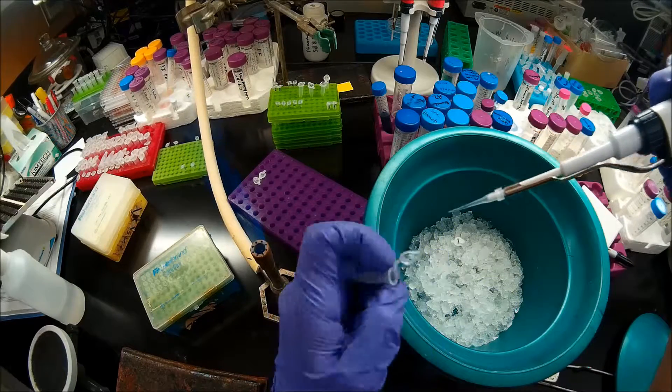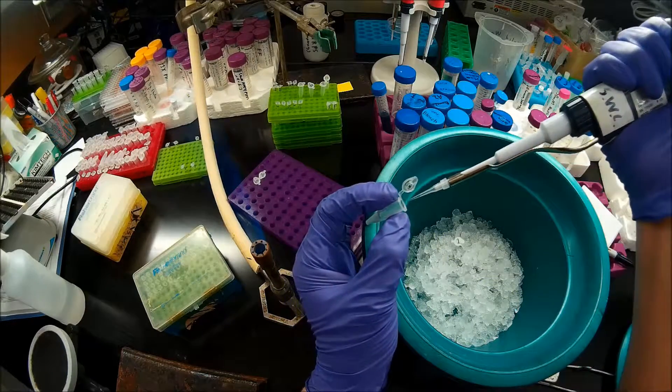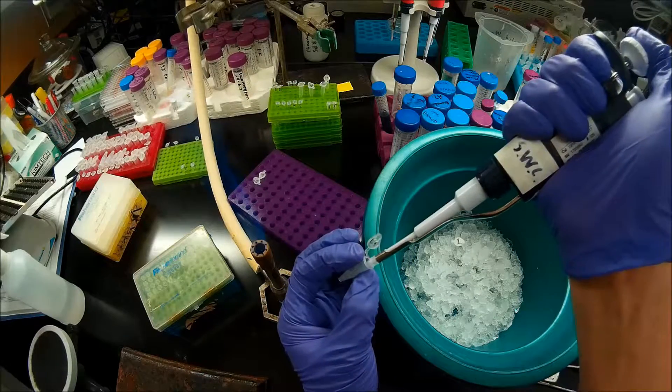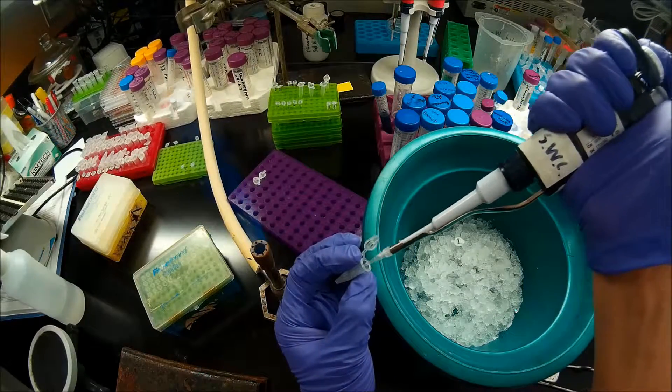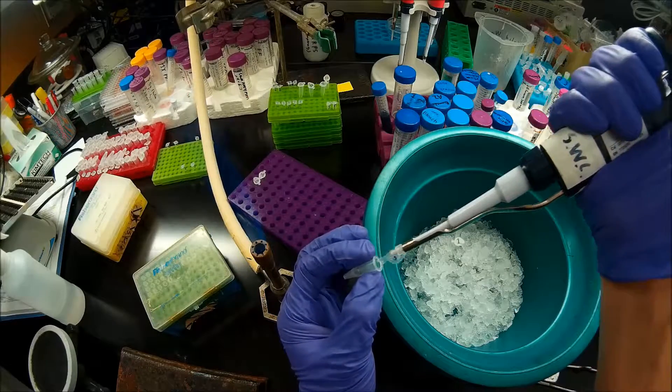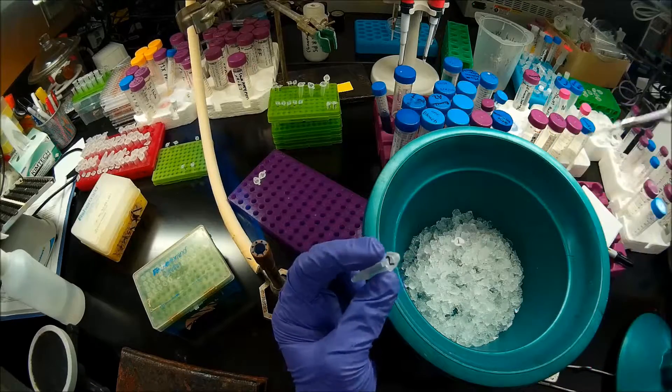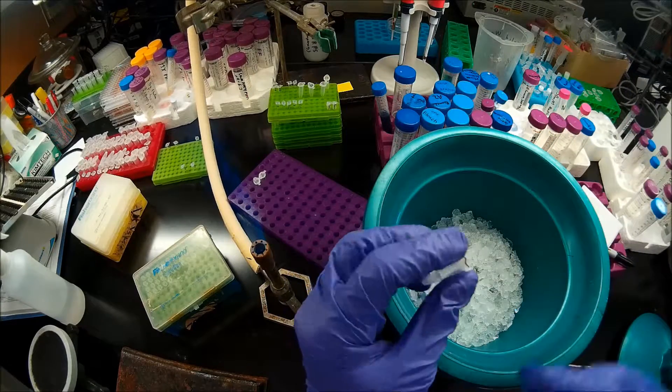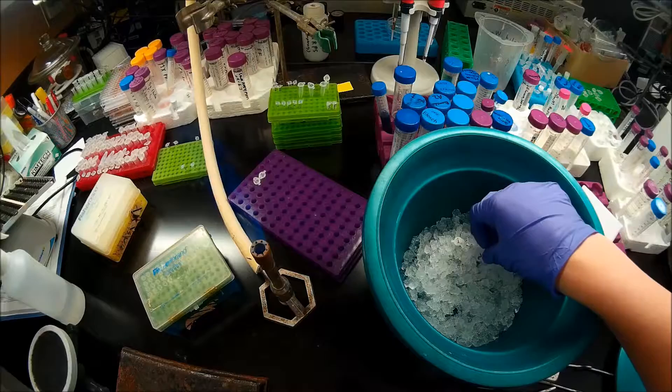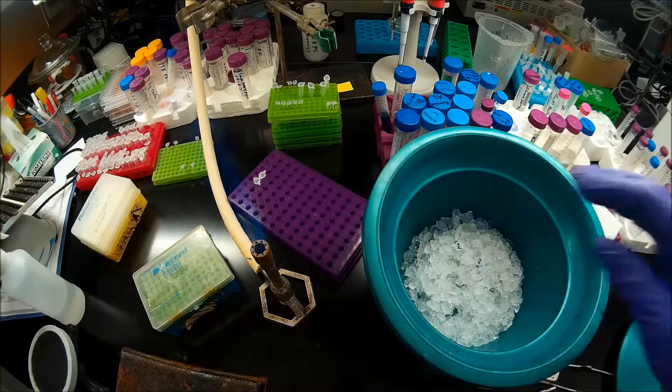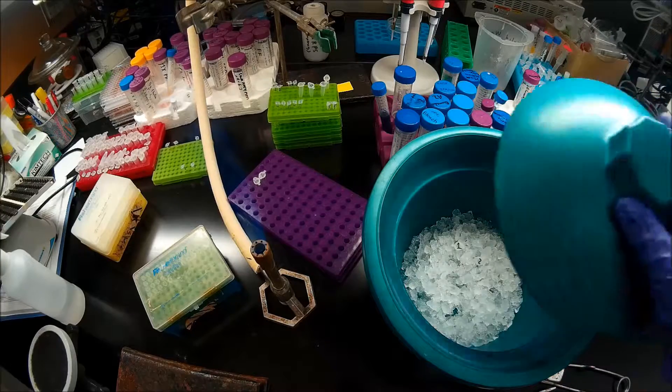But when I add the DNA to the competent cells, I'm just swirling as I dispense the material from the pipette. And then blowing bubbles through the volume a couple times to get vertical mixing. And now we're just going to leave those on ice for 5 minutes, or between 2 and 5 minutes.